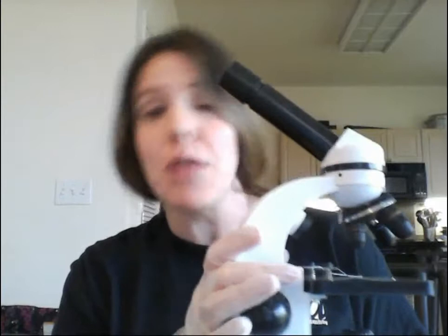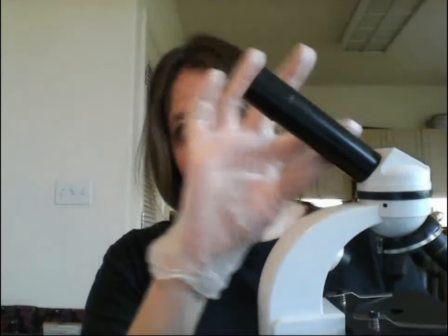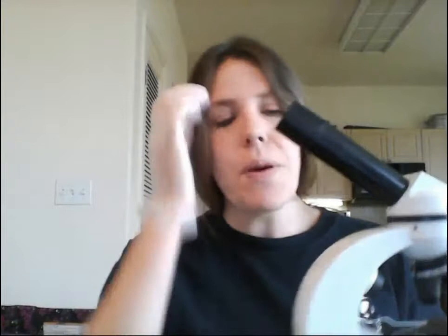The first thing I'm going to do is go over the parts of your microscope. You should understand the differences between this home microscope and the ones typically used in a face-to-face lab. Those are usually binocular, meaning they have two oculars — pieces you look through with your eye. You have a monocular microscope, meaning it has one ocular tube and eyepiece, so you've got to close one eye as you're looking through the scope.